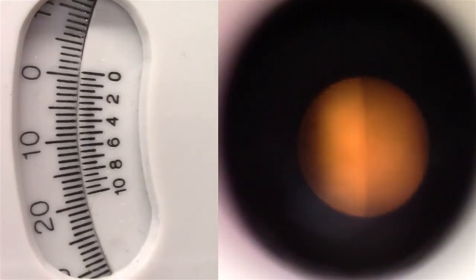To calibrate the machine, ensure that there is a uniformly colored circle visible through the eyepiece. Note that the inner and outer zeros on the vernier scale are aligned, which shows that the machine has been calibrated.